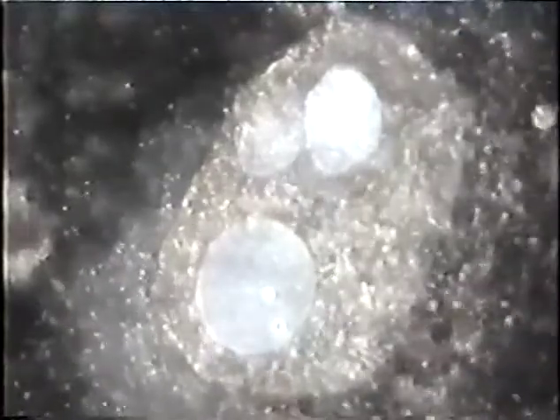Watch the large blue globule that just formed at the bottom of the screen and watch those little particles just kind of keep increasing. And what's quite a bit of curiosity here is although these particles are now leaving through a rupture in the wall of that blue sac, keep watching the films. You'll see these keep materializing and actually increase in number.